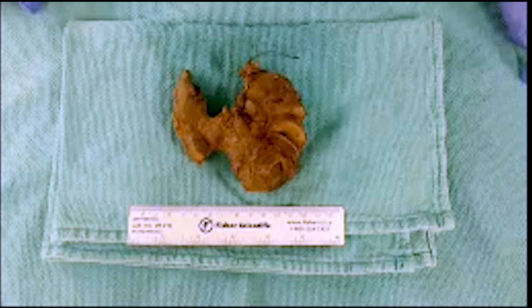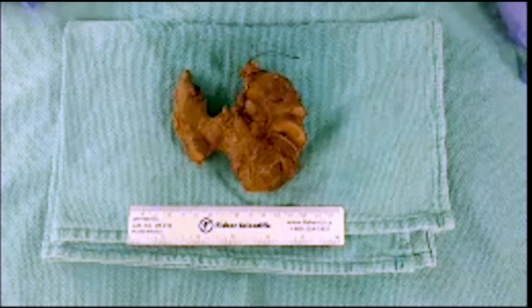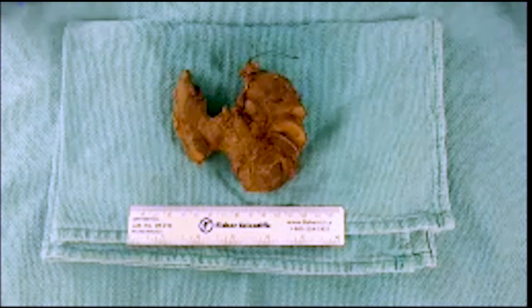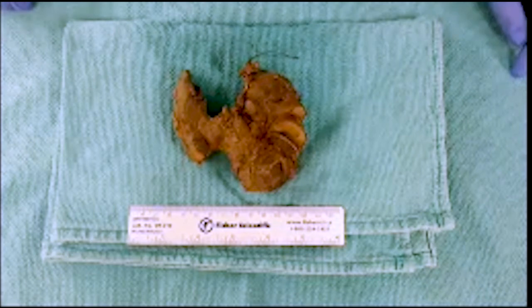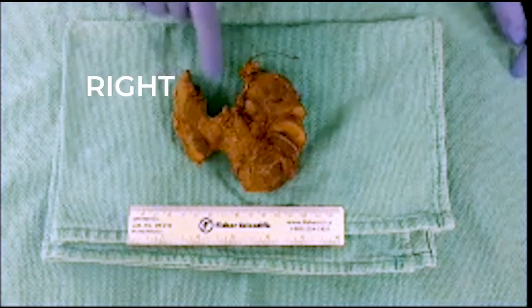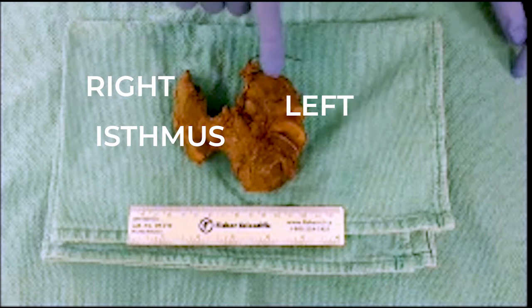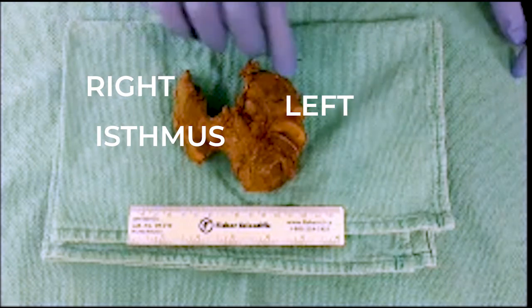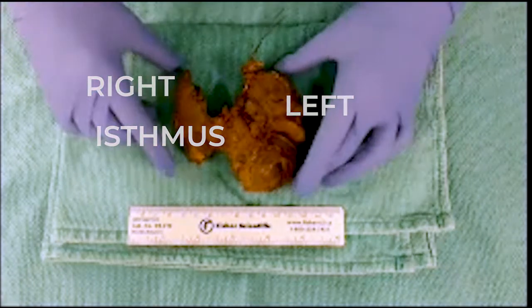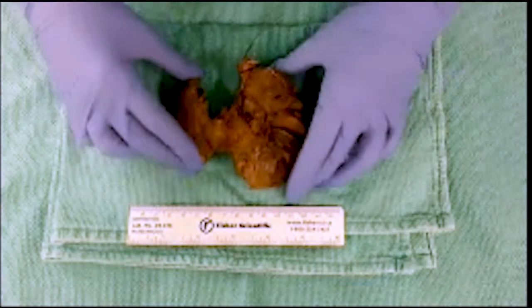Good job everyone. This is a thyroid gland, and normal anatomy of a thyroid gland consists of two lobes connected by an isthmus. In this case we have right lobe, isthmus, and left lobe, oriented with a stitch on the upper pole — so this is how it sits in the body. This is the anterior surface.